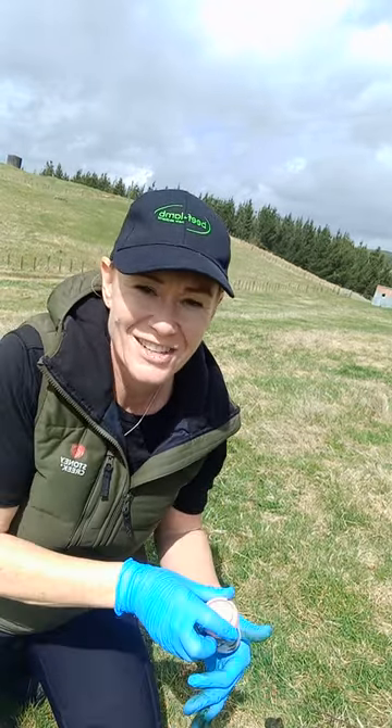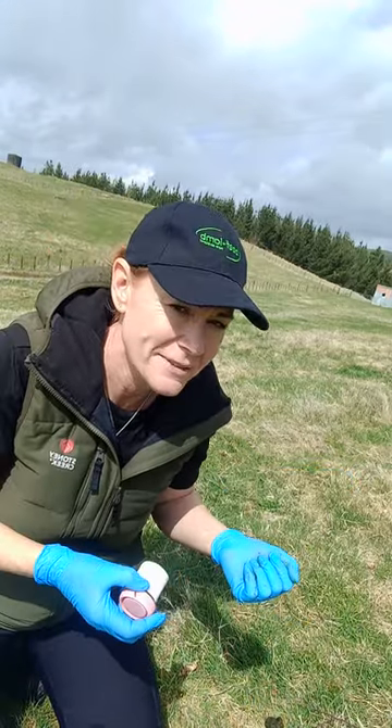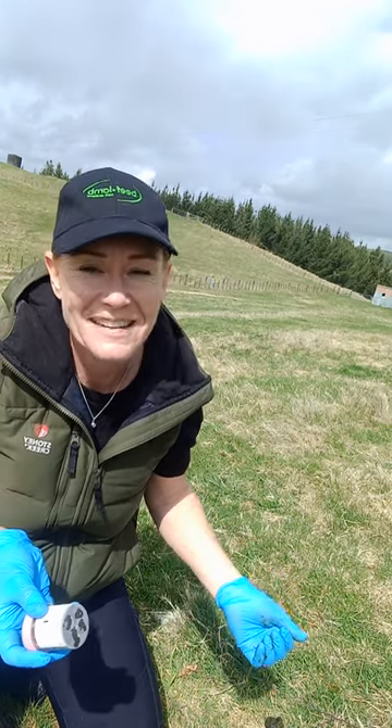Just make sure you pay attention to the other things like your own hygiene. Wear gloves, wash your hands afterwards. There are things like Salmonella and Campylobacter that can be present in sheep faeces and can make you sick, so we don't want those.